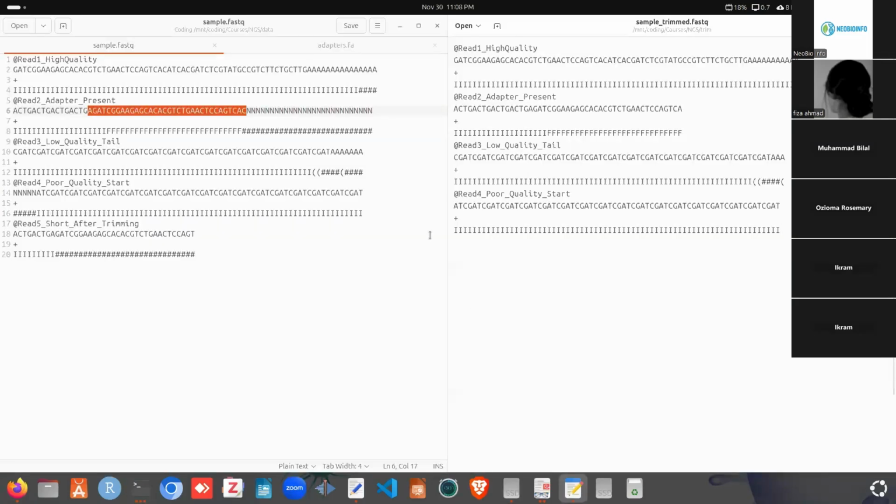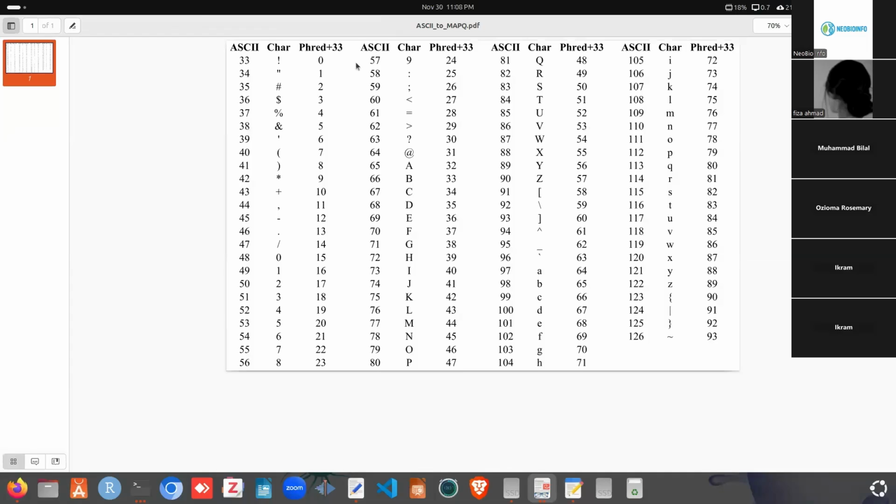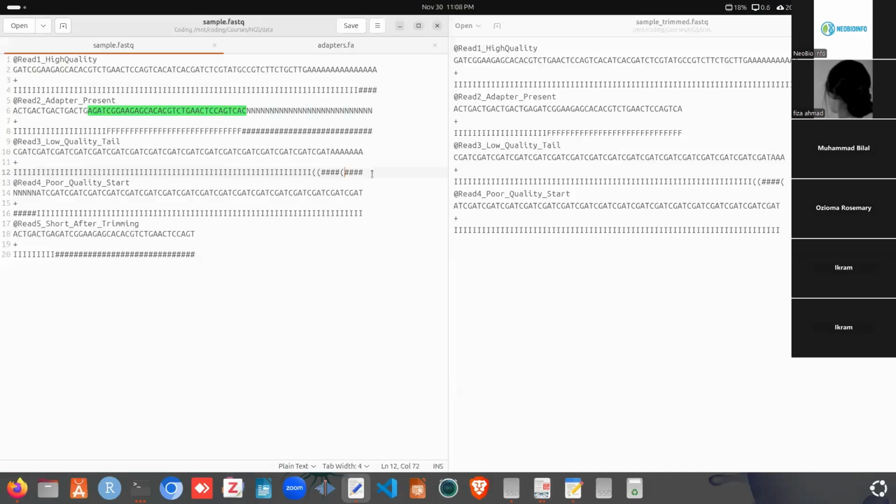Okay, so we specified the trailing parameter as 3 in here. I just told you that hash has the quality score. We can check the quality in here. Hash has the quality 2, so it is less than 3, so it will be dropped. And for the first bracket, it has the quality score 7, but we specified 3 as the trailing threshold, so it won't be removed. It will remove from right to left, and when it gets to the first bracket, it will stop in here. And if we specified trailing as 7 or 8, then it would remove all these bases and stop in here. That is, the I has the quality score of 40.